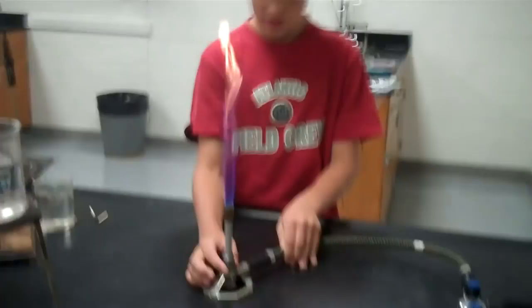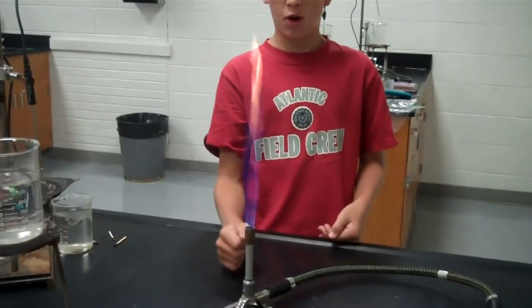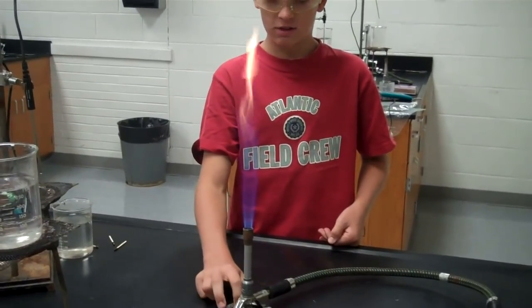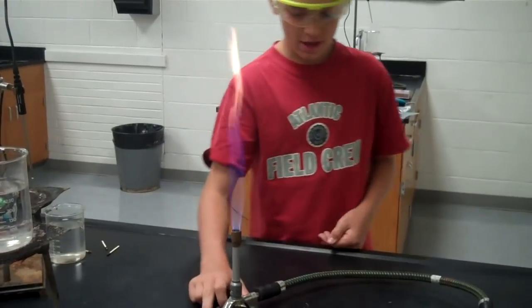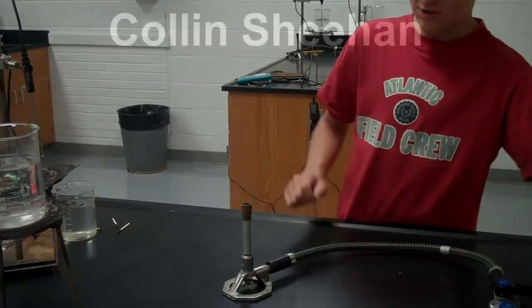And you never want to touch that top piece because it'll burn your skin. And that's the safety of how to use the Bunsen burner.